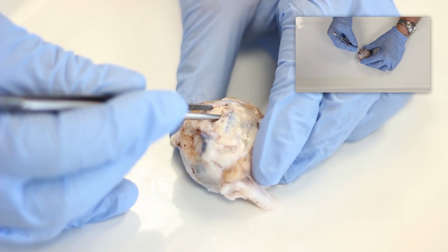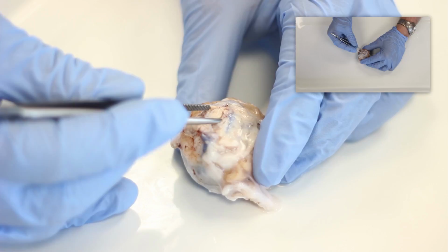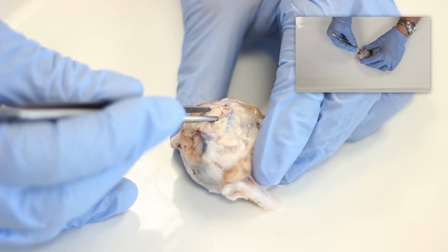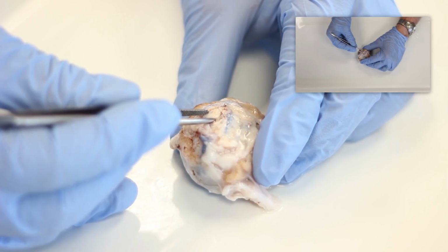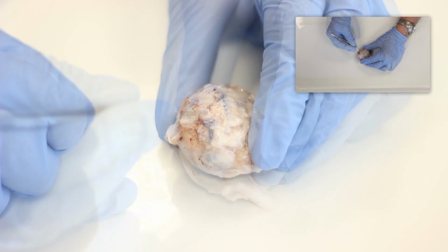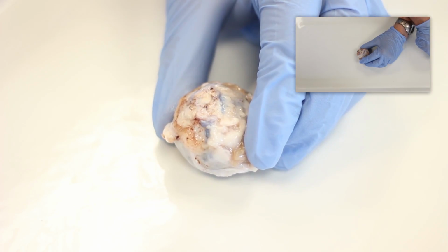Within the middle of the optic nerve are the myelinated axons of retinal ganglion cells that transmit visual information from the neural retina, the inner coating of the eye, to the rest of the central nervous system, the superior colliculus, and the lateral geniculate nucleus of the thalamus. Now let's examine the interior structures of the eye.